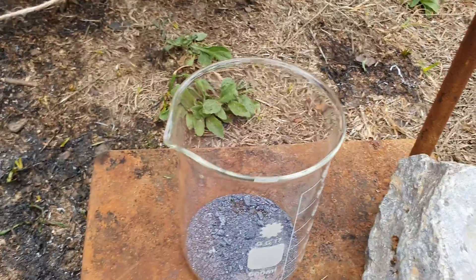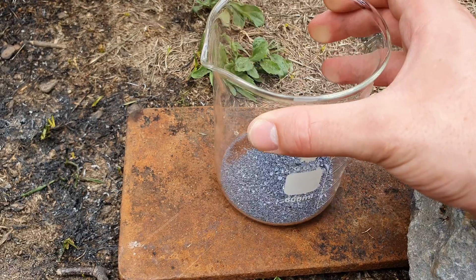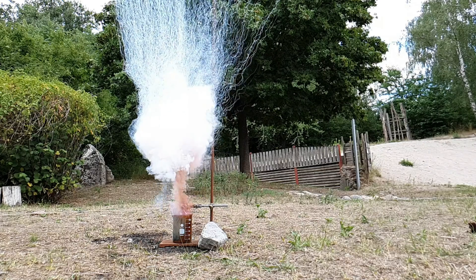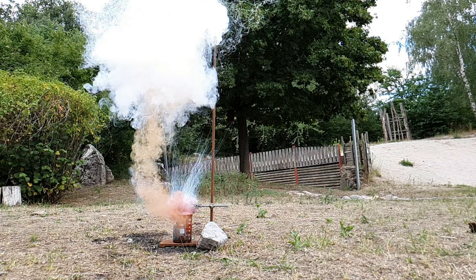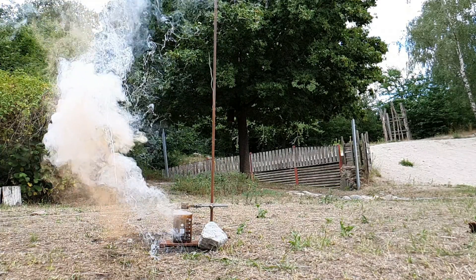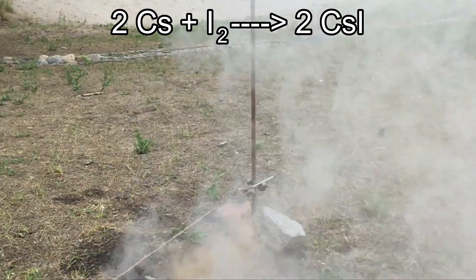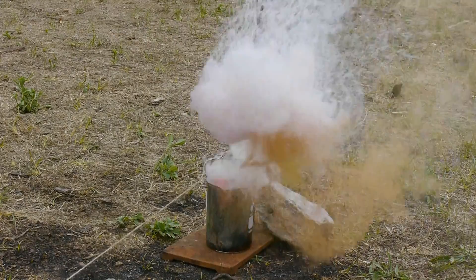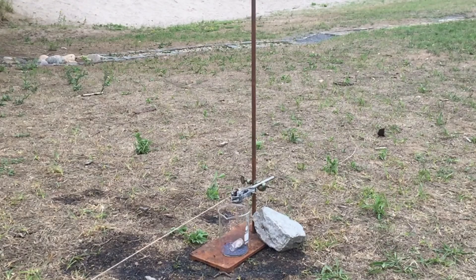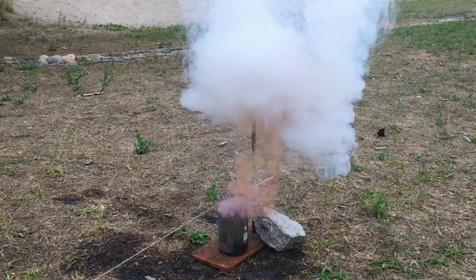Now that we know there is potential in this reaction, let's scale it up a bit. We filled some more iodine in a beaker to drop some cesium onto it from a safe distance. In this reaction, the cesium reacts with the iodine to form cesium iodide. The reaction is fairly tame because the reaction partners can't mix properly.